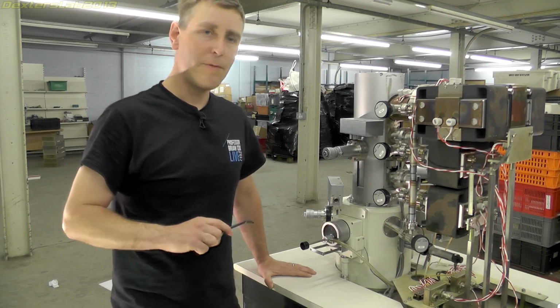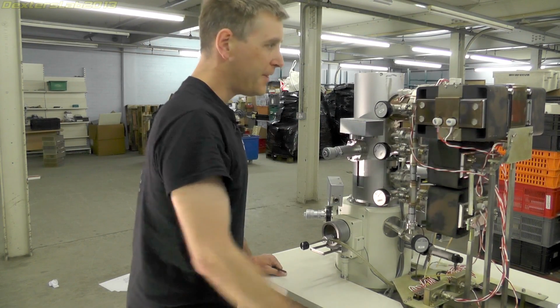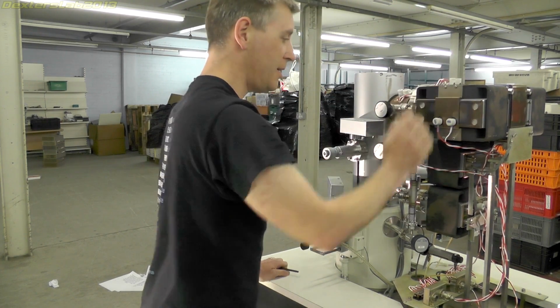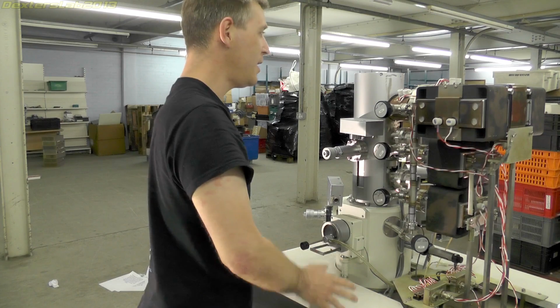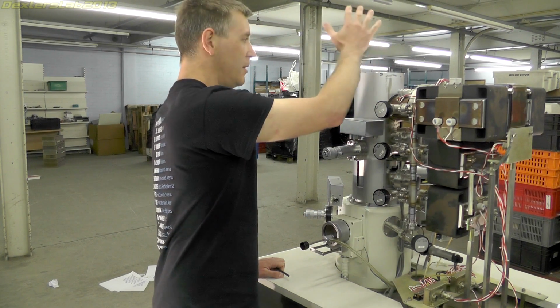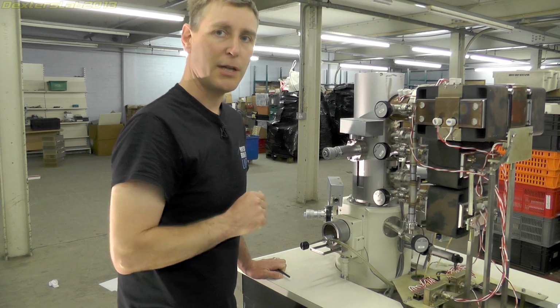Okay, what I want to do in the remainder of this video is remove these ion pumps. This big one weighs at least 23 kilos. These ones are probably about half that. So I want to get these removed, get a bit of weight off this. That will allow me to remove the actual electron gun and column assembly, because I want to take that apart separately in the lab.